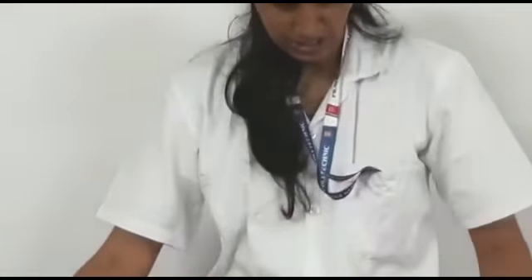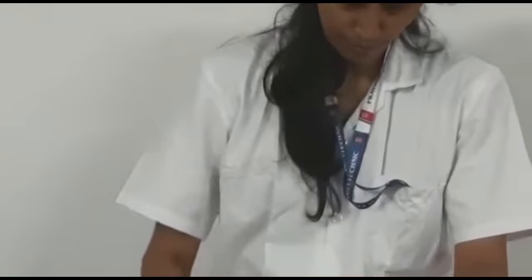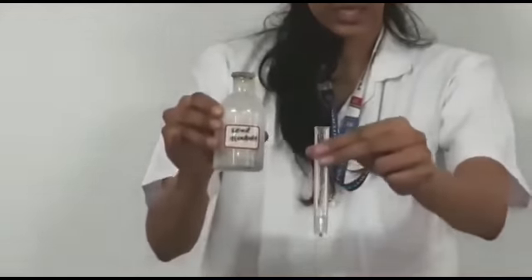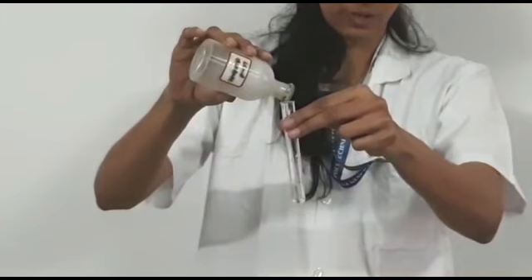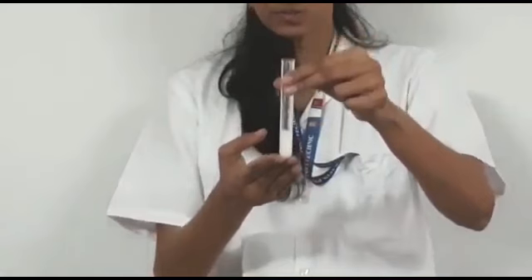Second confirmatory test is OS plus lead acetate. OS means original solution. We are going to add lead acetate. When we add the reagent, a white color precipitate forms. So we will confirm that SO4 2- is confirmed.